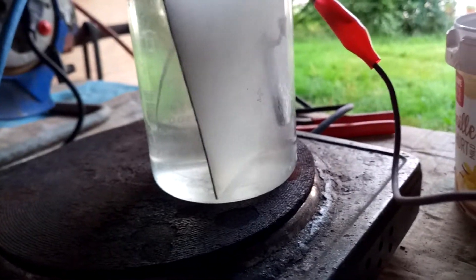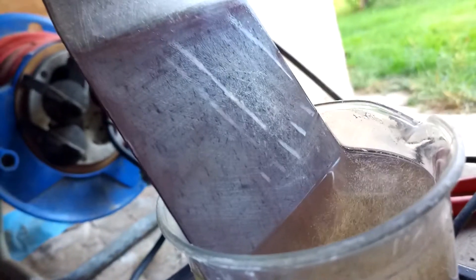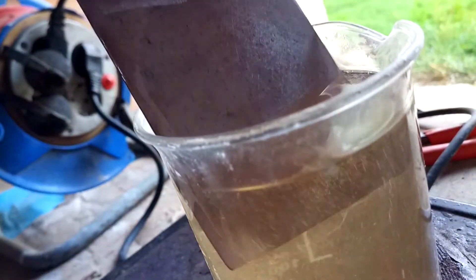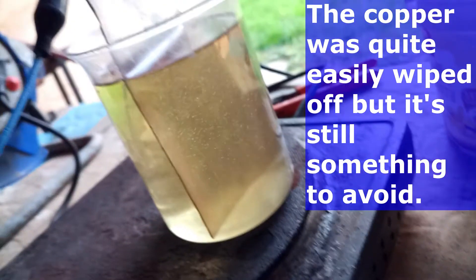There's yellow in there, and that actually etches the titanium. Now you can see it a bit — it has turned nice and yellow. The titanium is basically etched now; I'd have to keep this going for a bit longer, but then it would be etched. Seems like I did deposit some copper on it, but if I just redo this without the copper wire it should be fine.